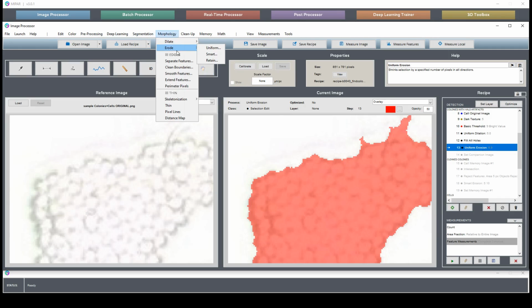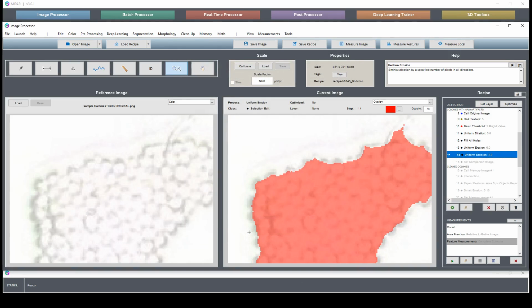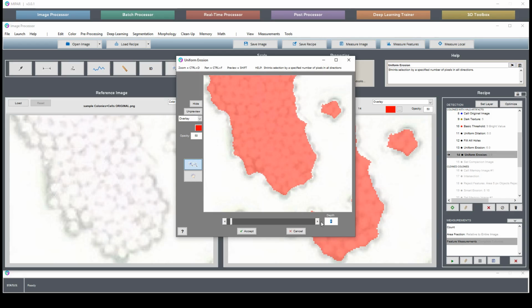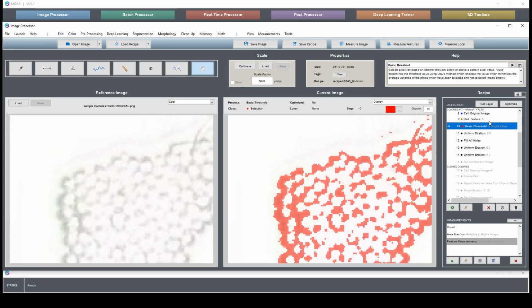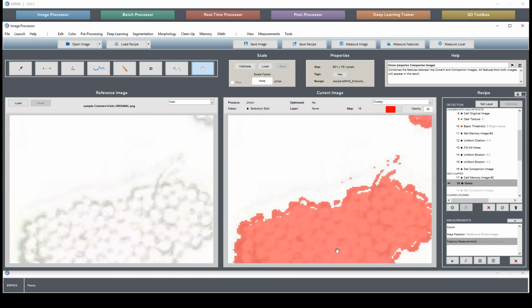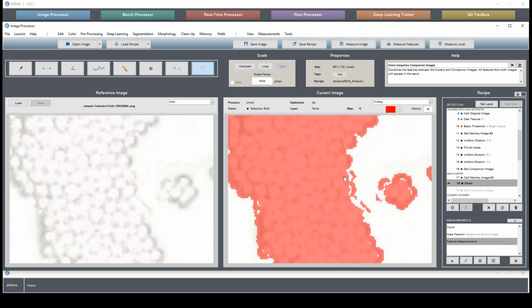So we have our center here, and we'll erode away just like so, say about that much, so that we're not finding any of these concave boundaries. Maybe a little bit more. Now, we can then find these edges precisely using this same selection that we had before. So if I take this, save it away, have this, set it as a companion, and add it to our precise edge selection, and we have something like this, where the centers are filled in, mostly, and our edge has a nice tight boundary.